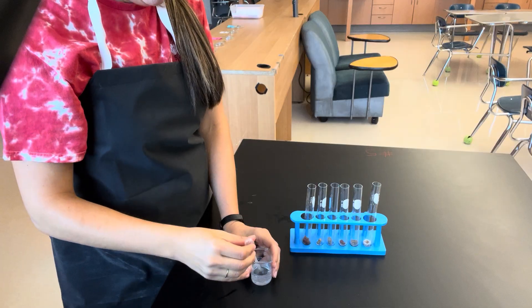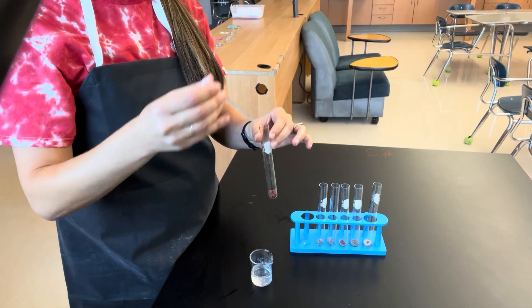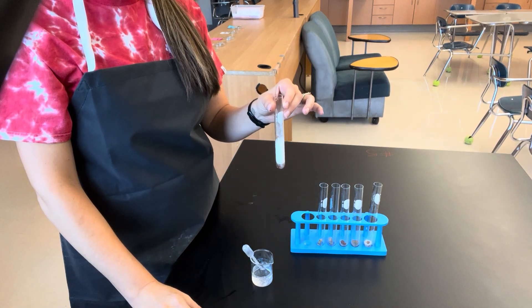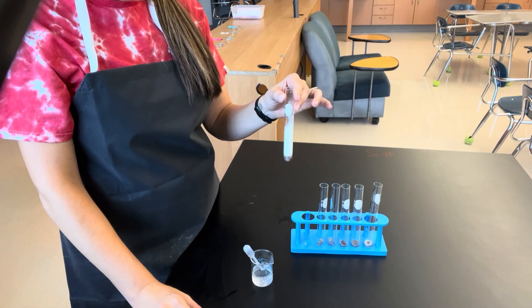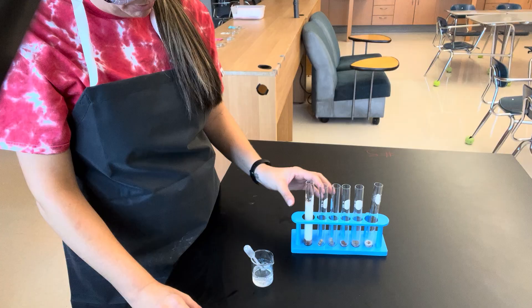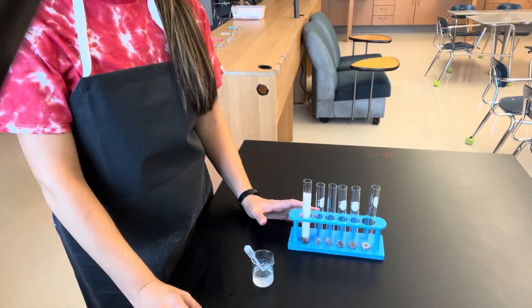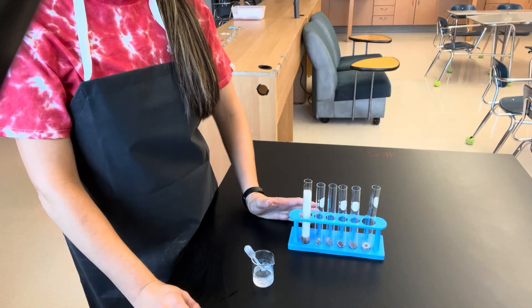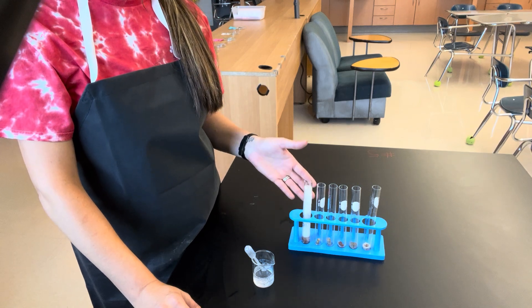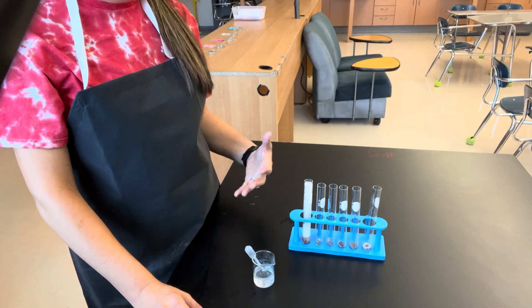We're going to start with our raw liver, which is serving as our control in this experiment. We're going to add about one to two milliliters of peroxide and observe the bubbles that form. As you can see, it's still bubbling — we're about halfway up the test tube at this point. With your group, you need to determine what you think the rate of this reaction is, starting with zero going all the way to five. It's okay if you want to change your rating later after viewing other reactions. Give this a rating from zero to five: zero being no reaction at all and five being a very extreme reaction.